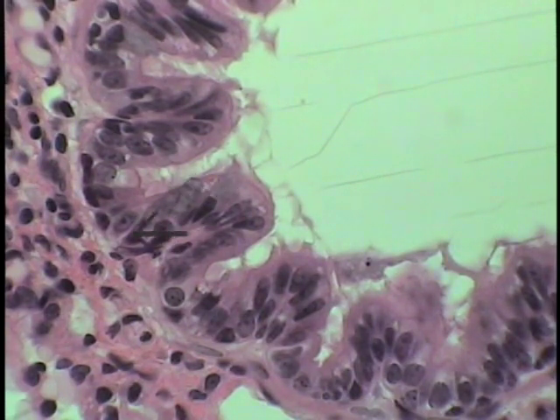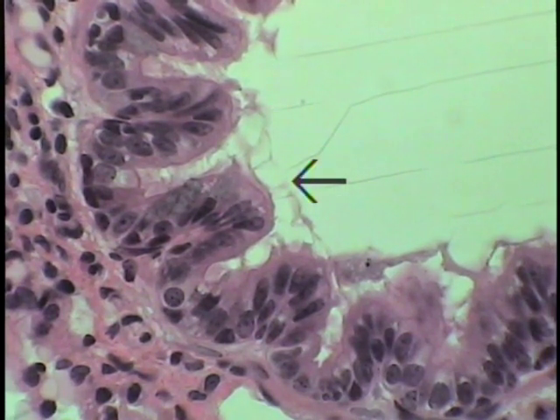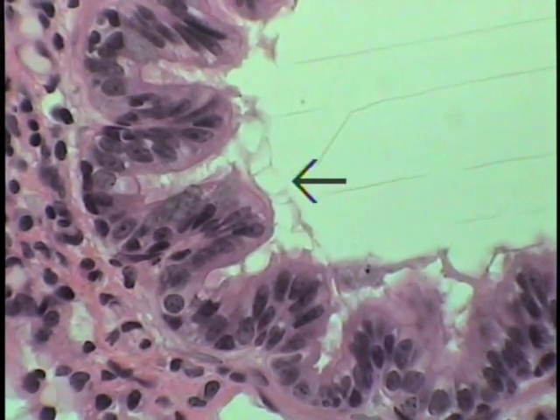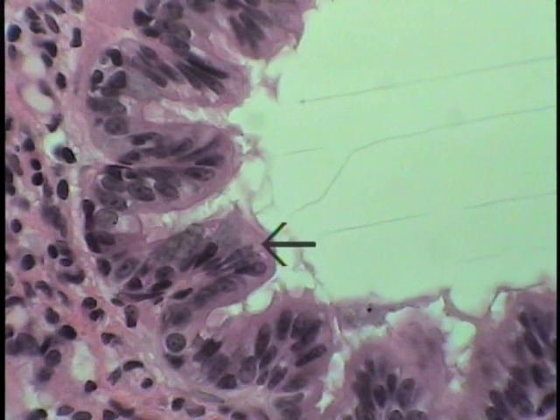One is shown and indicated by the pointer, these gray-looking granules, mucin granules that have taken up the dye. Another is shown here. So the goblet cells in this distal portion of the bronchus are much less numerous, and this is how it should be if you think about it. The mucus blanket is getting less and less thick. You want it to decrease and disappear at this point, and you have a ciliary beat going on distal to it.